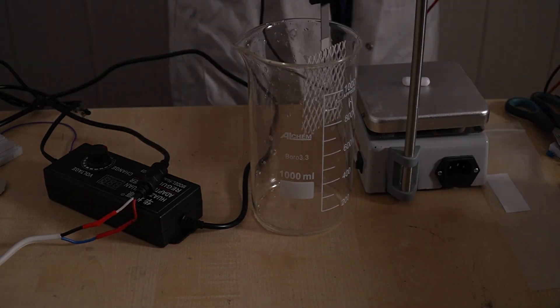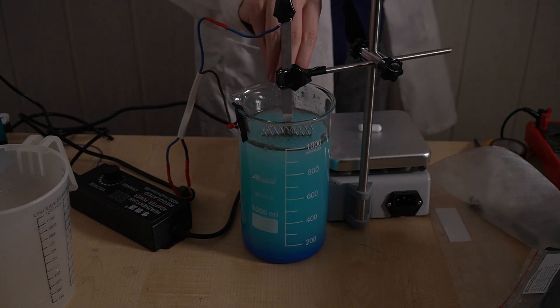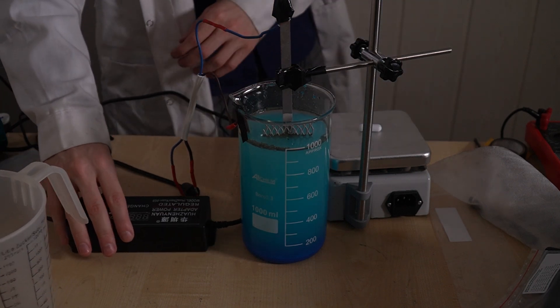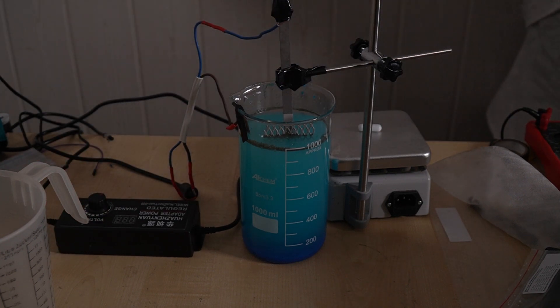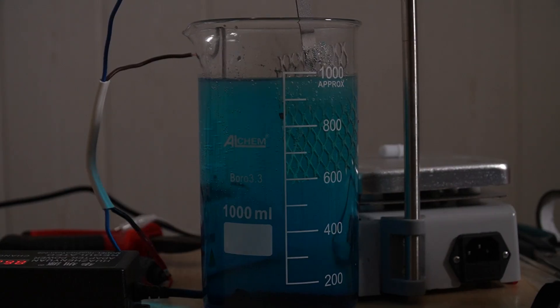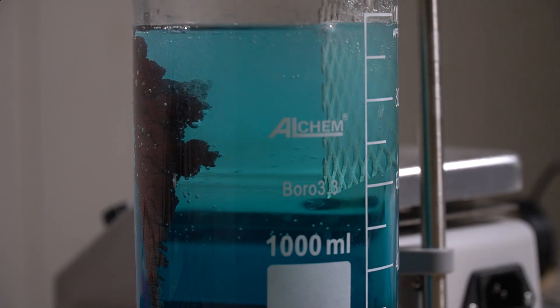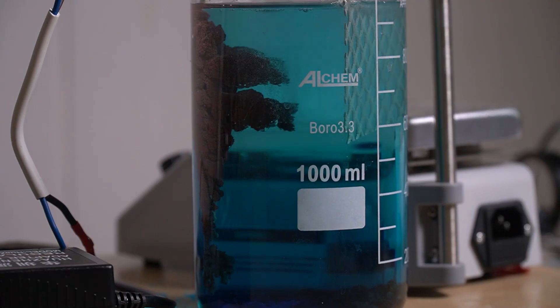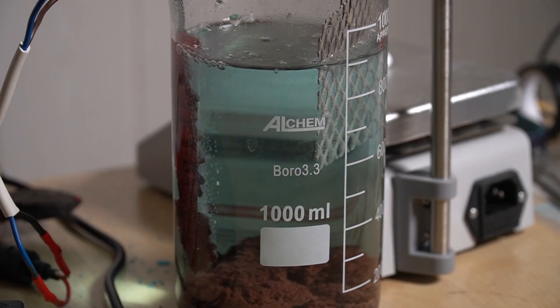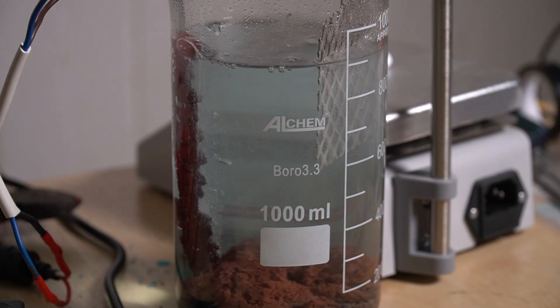What is happening? We started with water, then we added blue crystals, then we plugged it into the outlet through this weird mesh, and that's supposed to make sulfuric acid? How in the heck is this working? Well, that's what I'll explain in this video — exactly how to make sulfuric acid using this method.